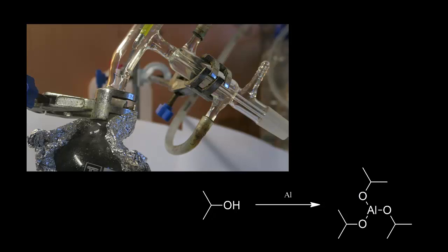The stuff coming over is actually not pure aluminum isopropoxide because it's way too runny, so it's likely contaminated with isopropanol. After a second distillation though, I got some pretty pure stuff.